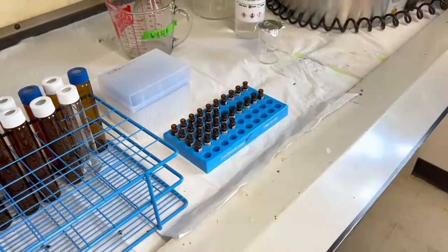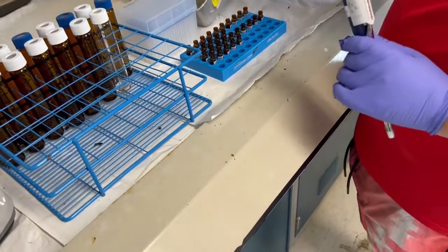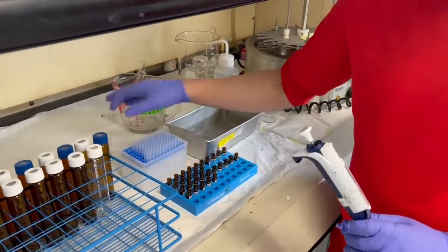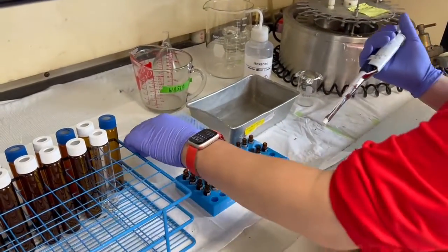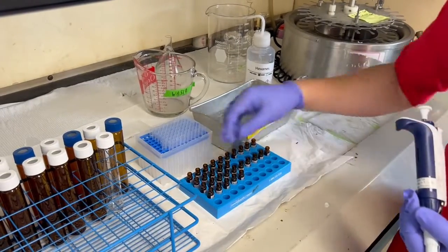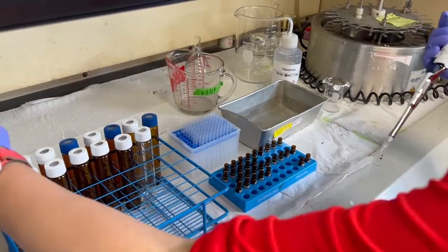And many. So we want to have, because we have two milliliters of each, we want to give one milliliter to each of this.